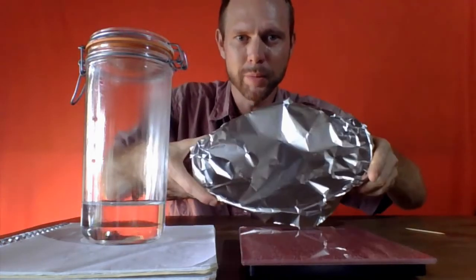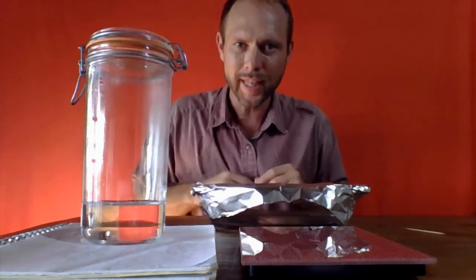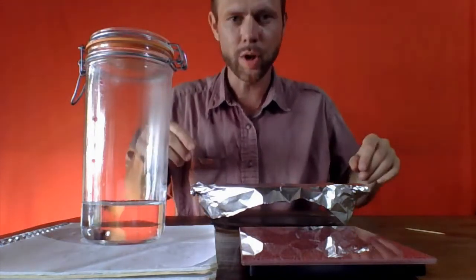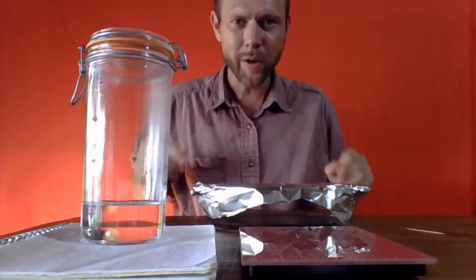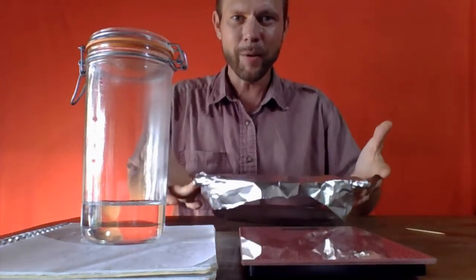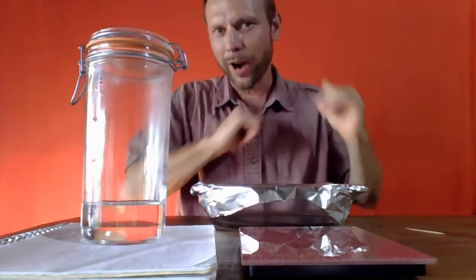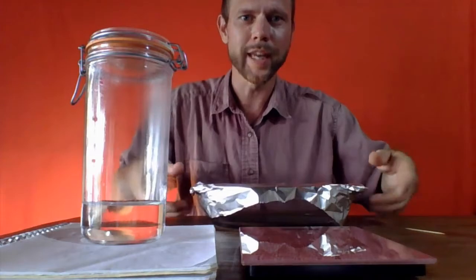So I'm going to put some holes in the aluminum foil, and it's empty. It's going to go in the oven like this, plus the water and salt. The water is going to cook out, and we're going to be left with salt in this dish. And the strategy here is I'd like to know how much this weighs. That way we can weigh it again after we take it out of the oven, subtract the two numbers, and have how much salt we've recovered.